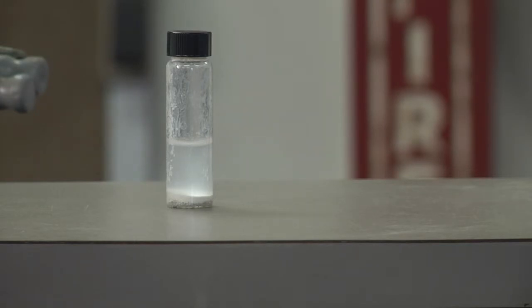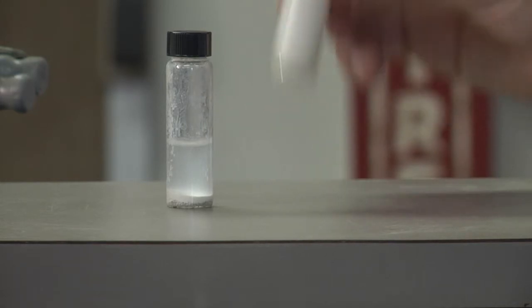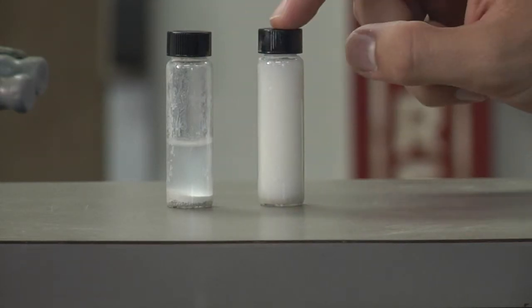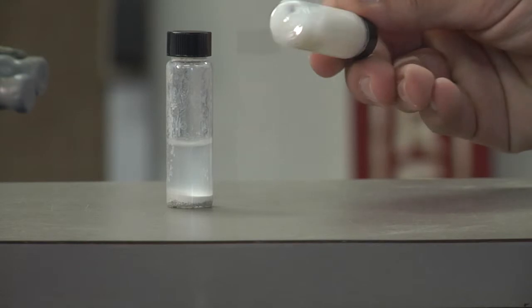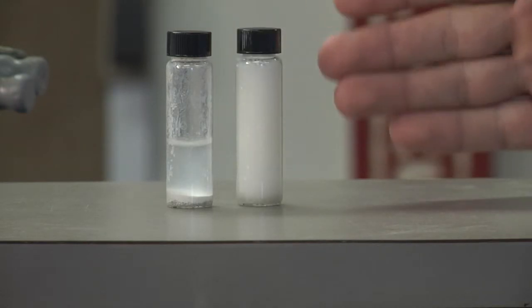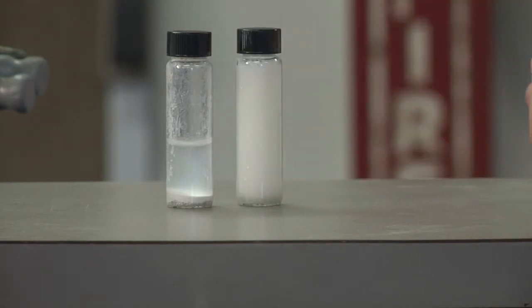But first, you've got to shake it to get it well mixed. It should turn into a homogeneous mixture. As mentioned before, today's lab is fairly simple. We will start primarily with barium nitrate, sand, and clay. Now barium nitrate and clay are both soluble in water, so if we allow it to settle or if we use a centrifuge, we will allow these two to be separated from the sand.